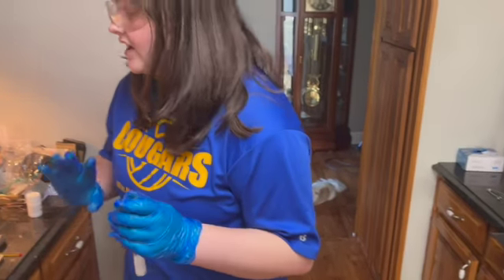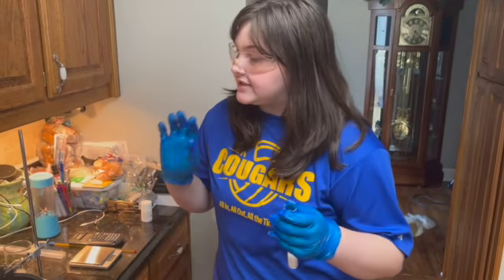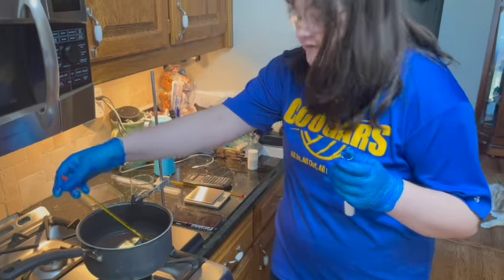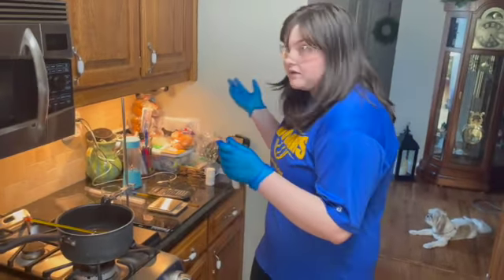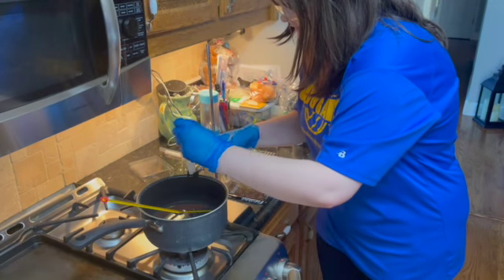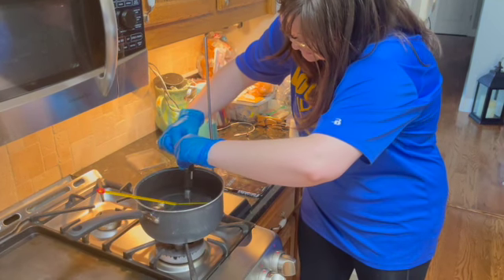Okay, so we've already measured out our paradichlorobenzene, and mine's at 6.55 grams. And the hot bath is already at its appropriate temperature, which is at 54 degrees Celsius. So now it's time to put it in, and I gotta make sure that I start the clock. So I'm gonna set this in here, make sure it goes all the way in, and tighten it.